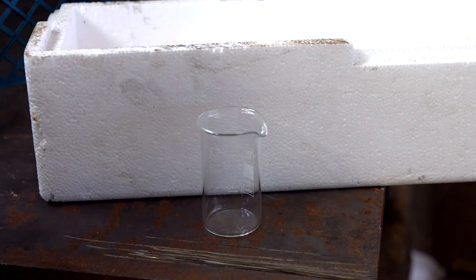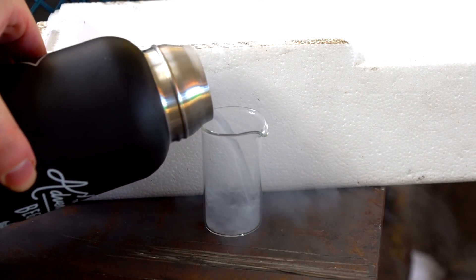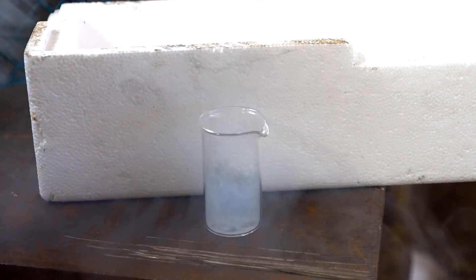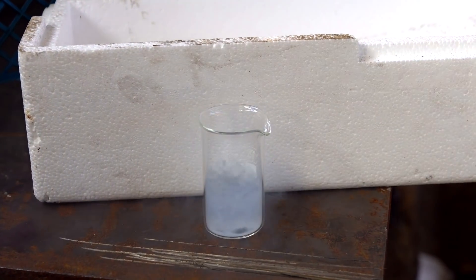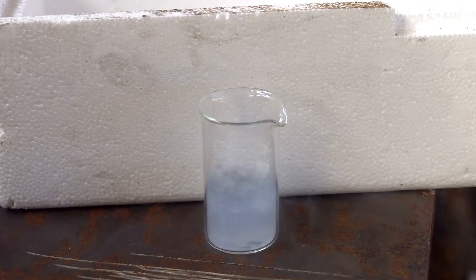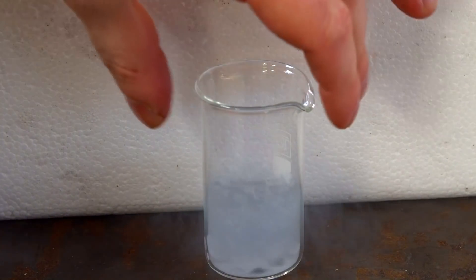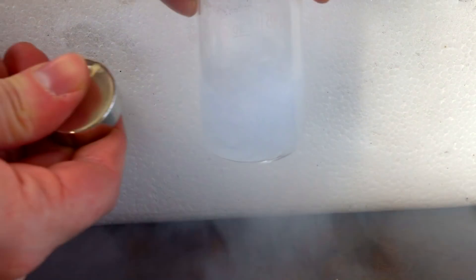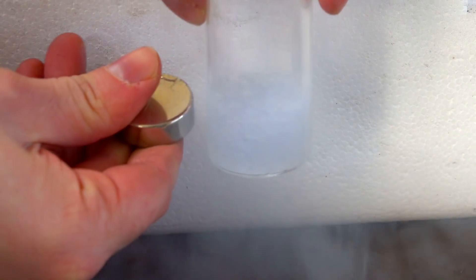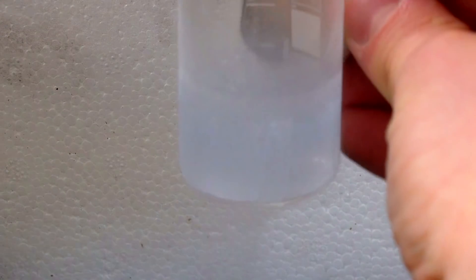Now we have obtained liquid oxygen — let's look at its properties. The most interesting fact is that in liquid state, oxygen is not a transparent liquid; it is in fact blue, due to the light absorption spectrum of oxygen atoms. Liquid oxygen is also paramagnetic and is attracted to magnets, and looking closely we can see small droplets rising towards the magnet.